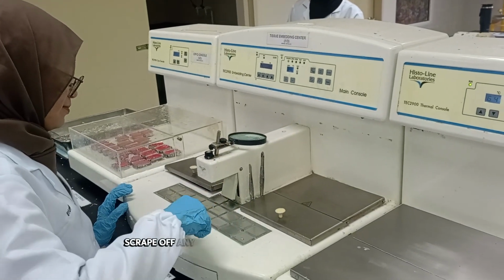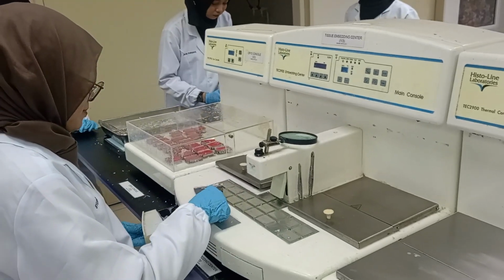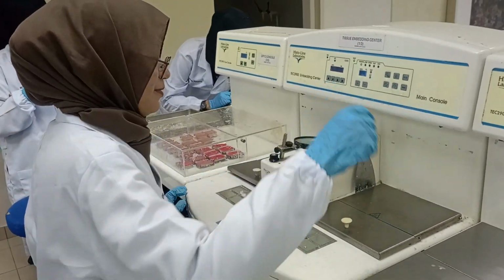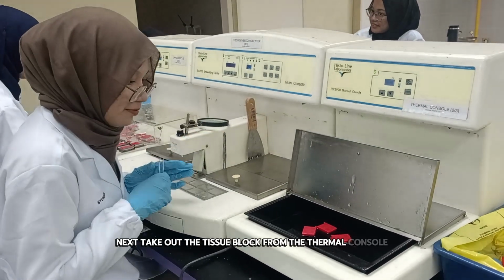First, scrape off any excess wax from the embedding center to clean the surface. Next, take out the tissue block from the thermal console.